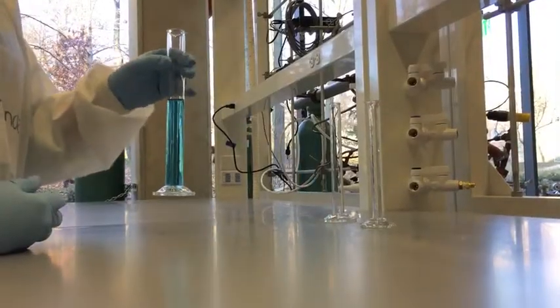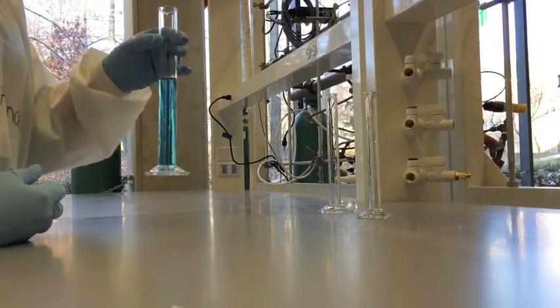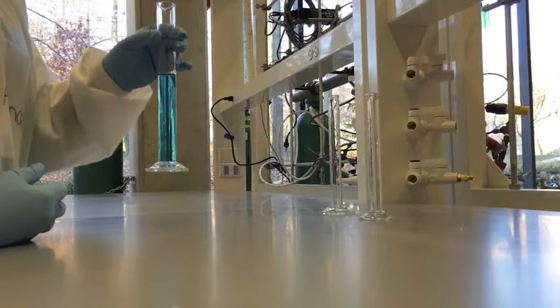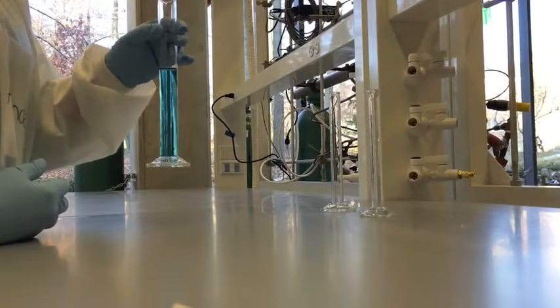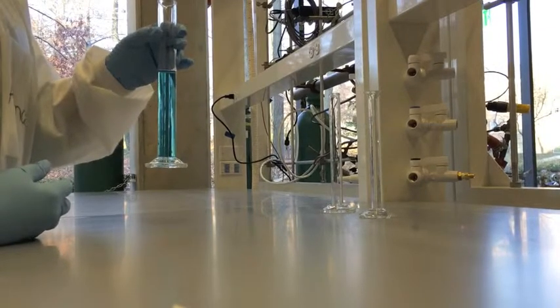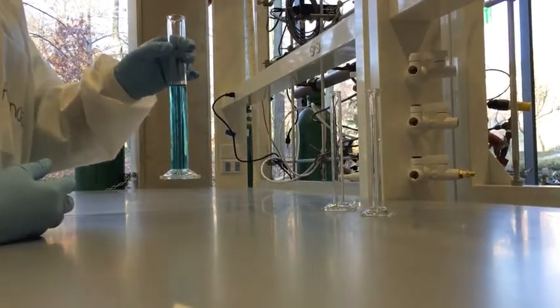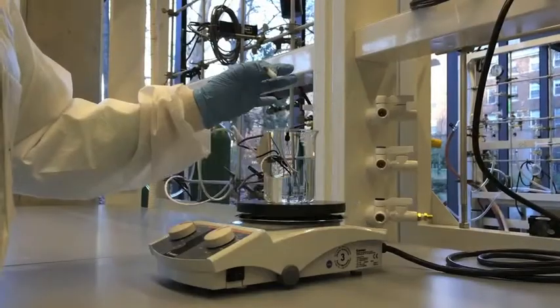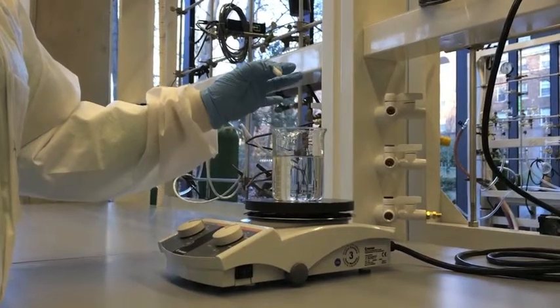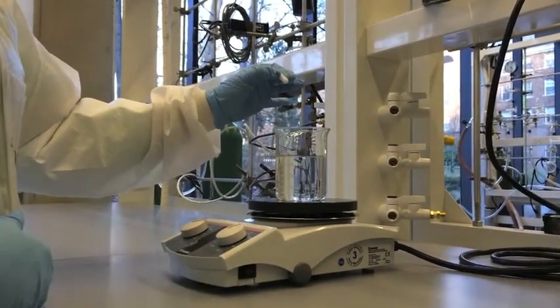A graduated cylinder is used to measure the volume of a liquid. They are generally more accurate and precise than flasks and beakers. Graduated cylinders are meant to be read where the meniscus lines up with the bottom of the graduated lines and is accurate to 1%. Typically, the capacity of graduated cylinders is between 5 milliliters and 2,000 milliliters. A stir bar or magnetic stirrer is a device that employs a rotating magnetic field with a stir plate, causing the stir bar to rotate in solution.